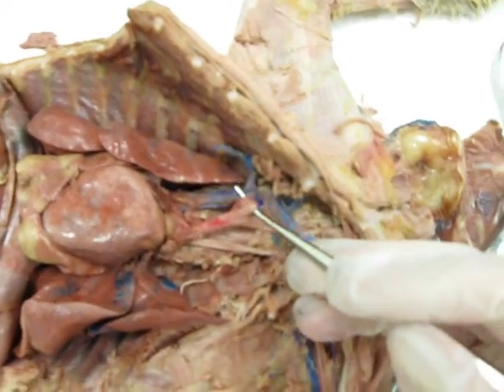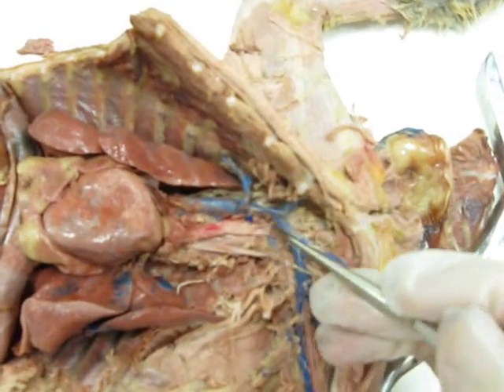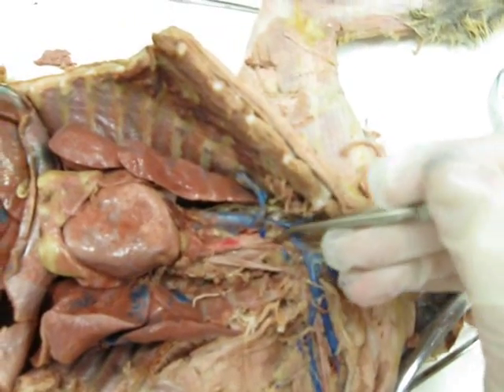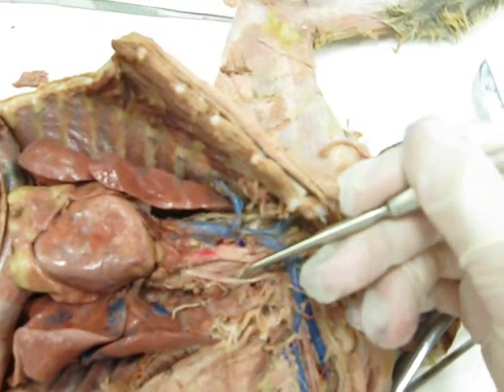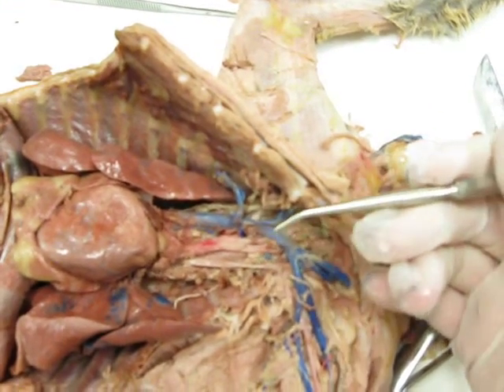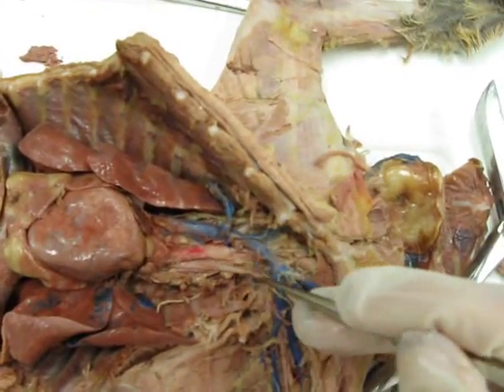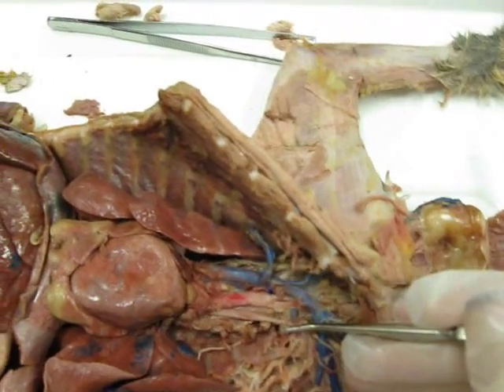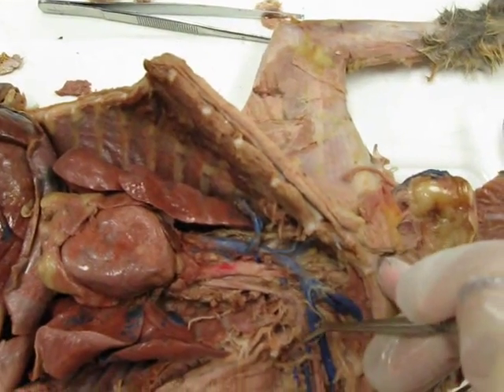This one, the farthest to the right, is your right subclavian. Then you have your right common carotid, and then your left common carotid. And remember, the left subclavian is its own branch off of the aorta. From there, the left subclavian gives rise to the vertebral, which is right there next to the vein. And then from there it becomes axillary through the armpit region.